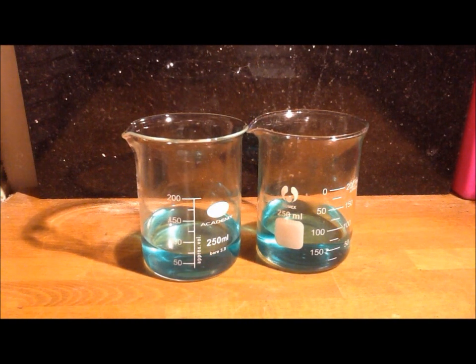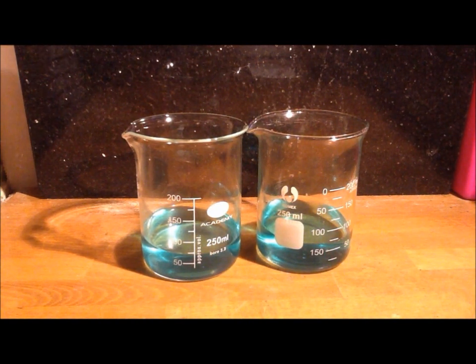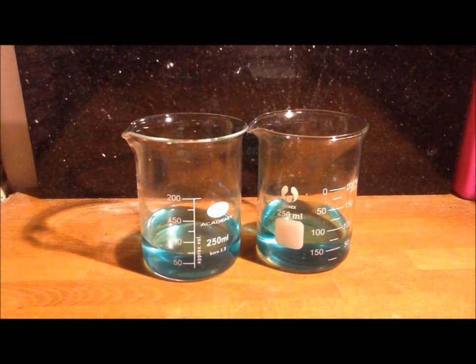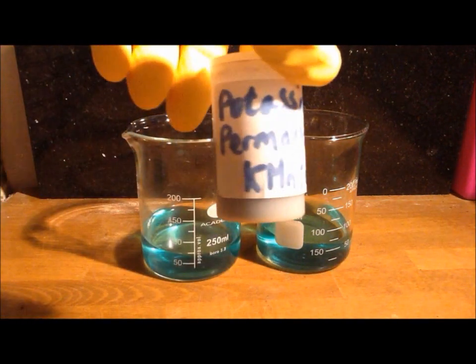Okay, so the chemicals you will need for testing the bleach is hydrochloric acid and potassium permanganate.